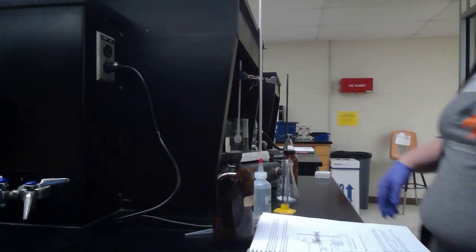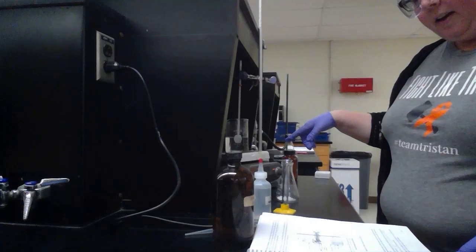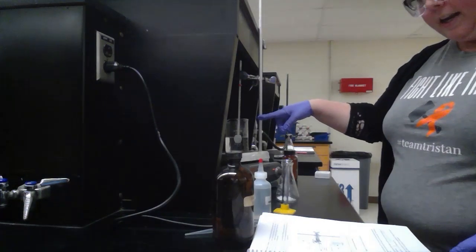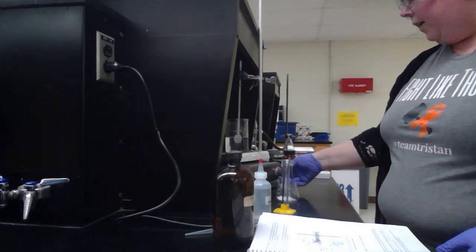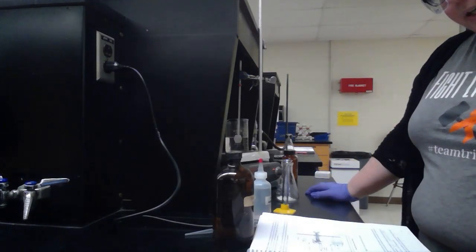So what I have here is my hot water bath heating up. It's not quite where I need to be, so I'll have to wait a little while for it to get between 70 and 80 degrees.